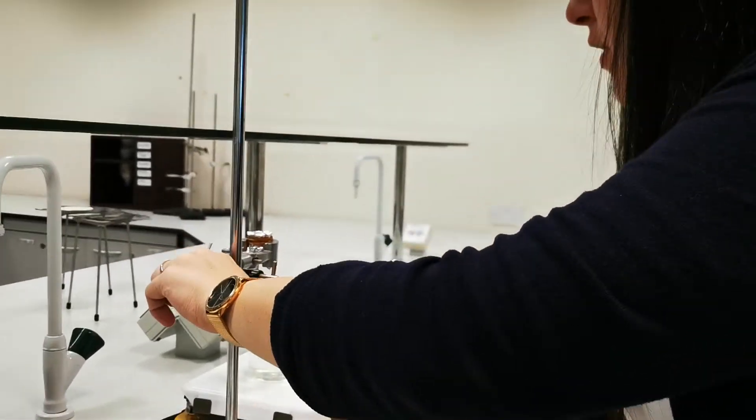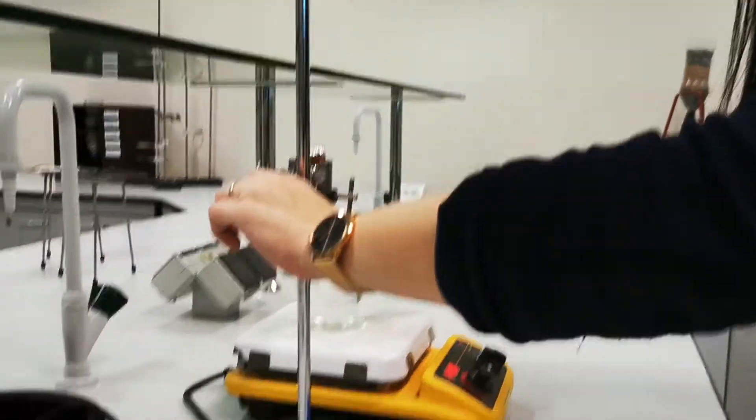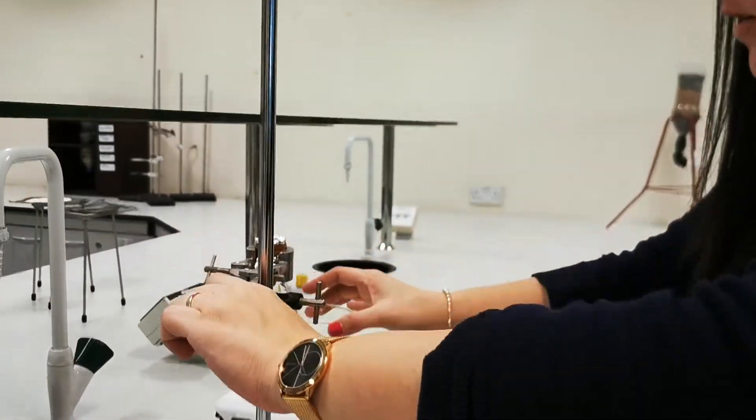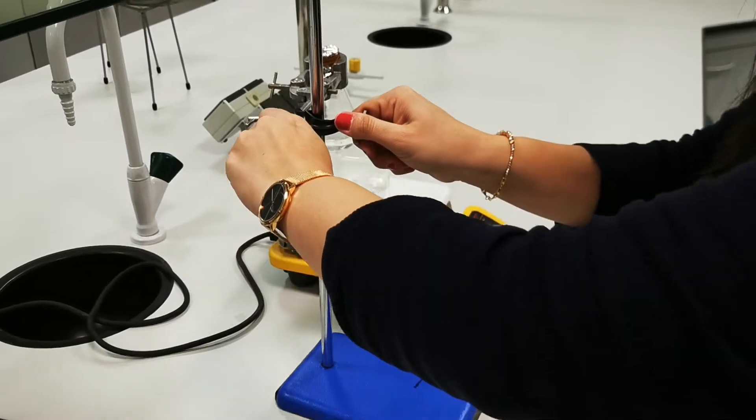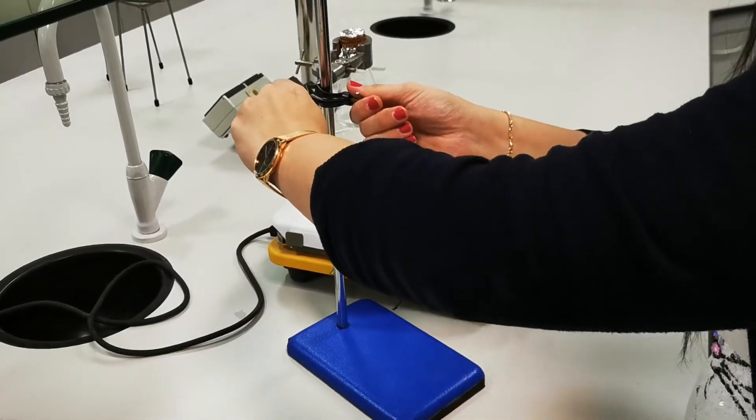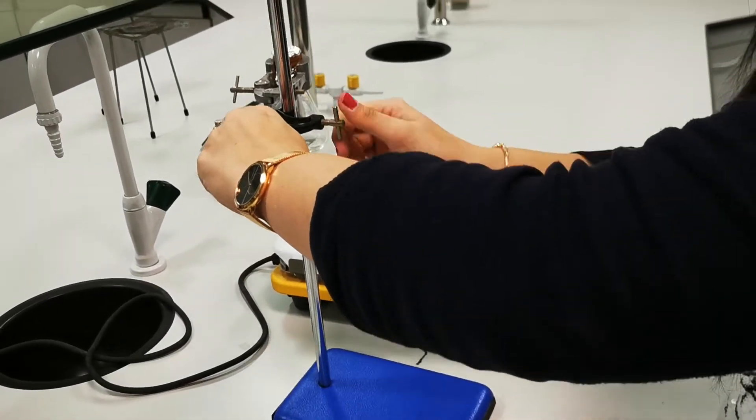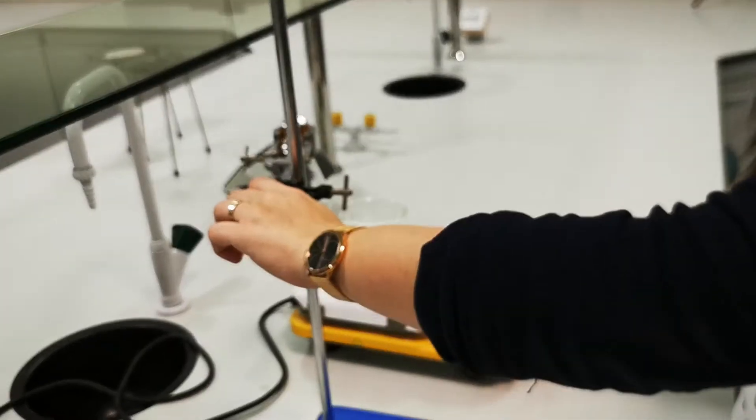So, once the liquid is boiling, I'm just going to push it a little bit, and I will put this inside. So, right now, I'll just wait a little bit until the water boils.